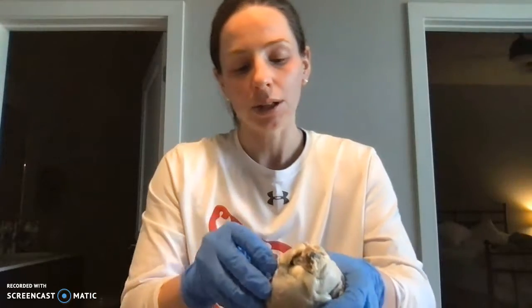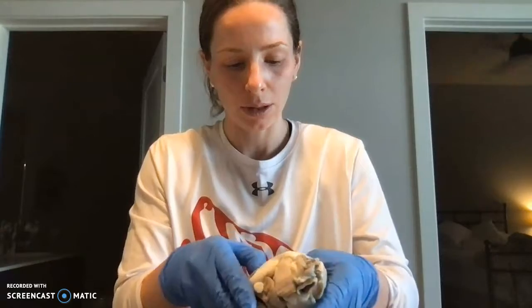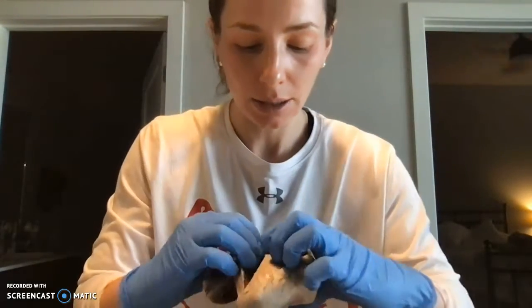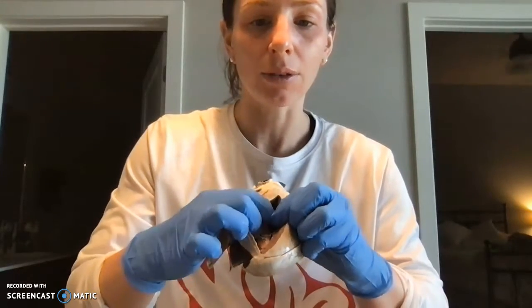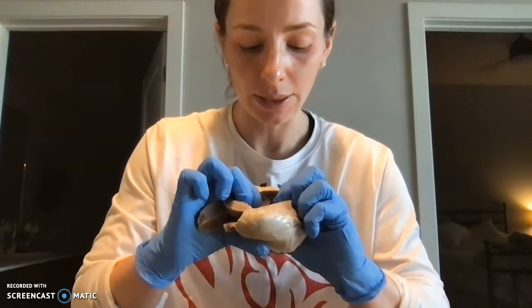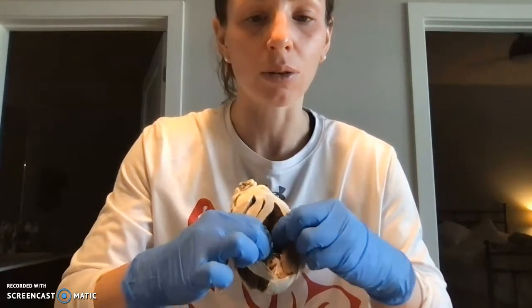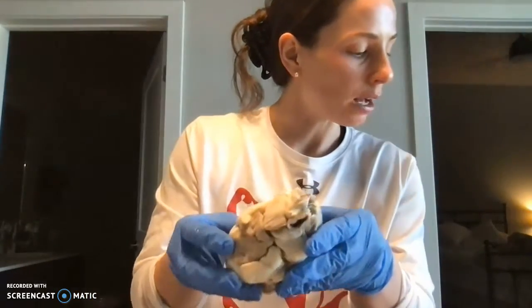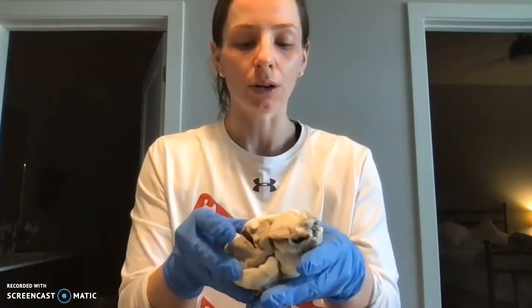And then if we come to the right side, here we have the right ventricle down in here, and we have the right atrium up in here, and on this side we have the tricuspid valve, and you can also see that chordae tendineae on that side supporting those valves. So then we also have the aortic valve.